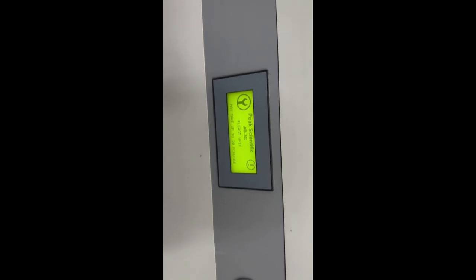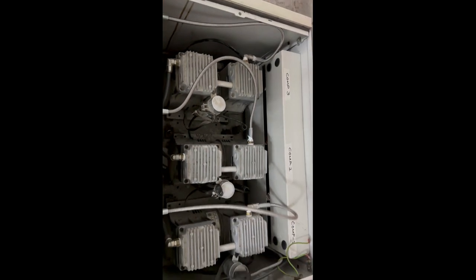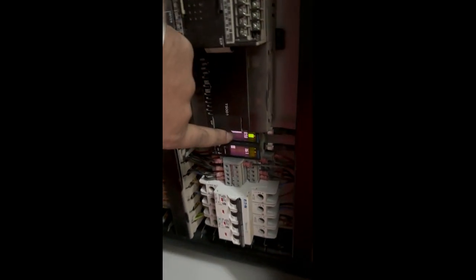So today is our third day, and we have just turned on the system, and this message is being displayed. And what we did, we replaced those pipes, and we made some settings over here, and I found some valves stuck.